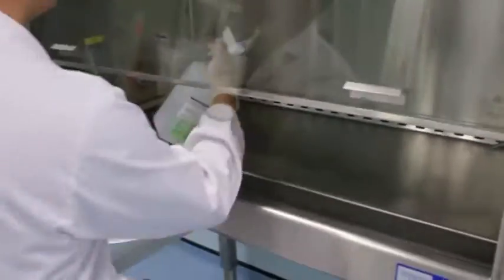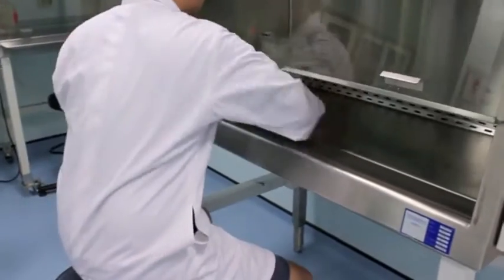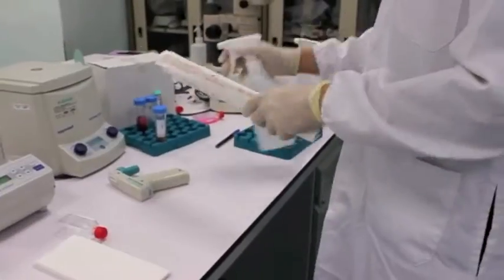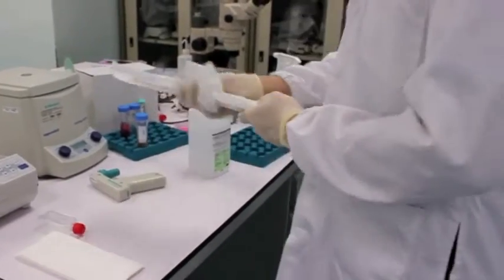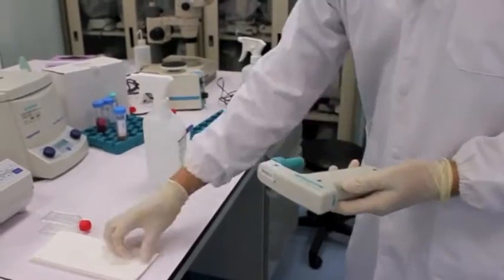Also remember to spray and wipe down the hood with 70% ethanol to sterilize the working area. Make sure to spray and wipe down all equipment that is to be used inside the biosafety cabinet.